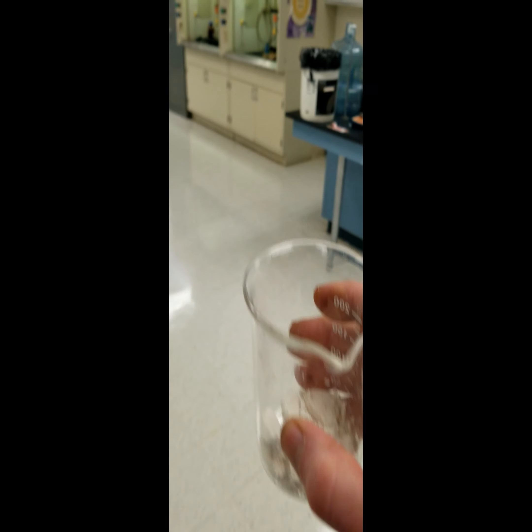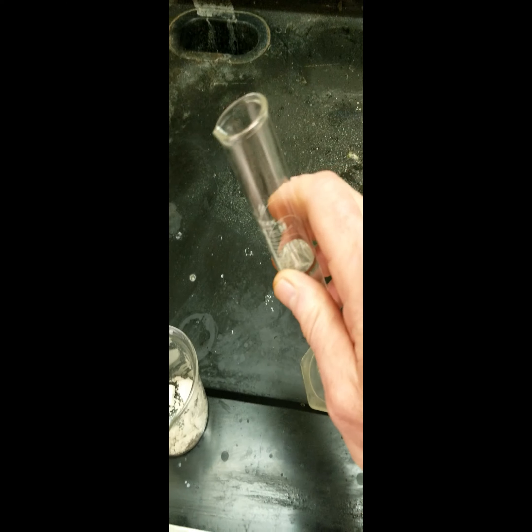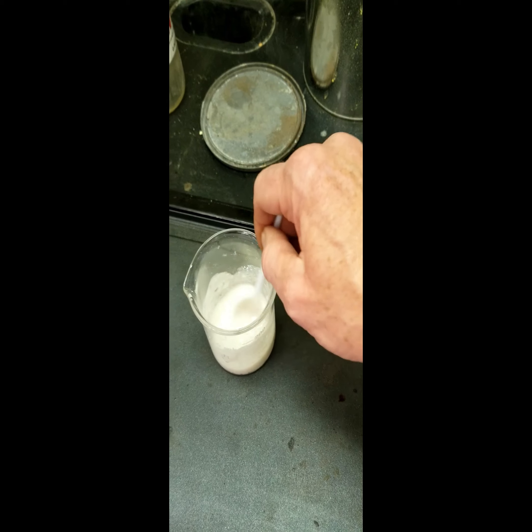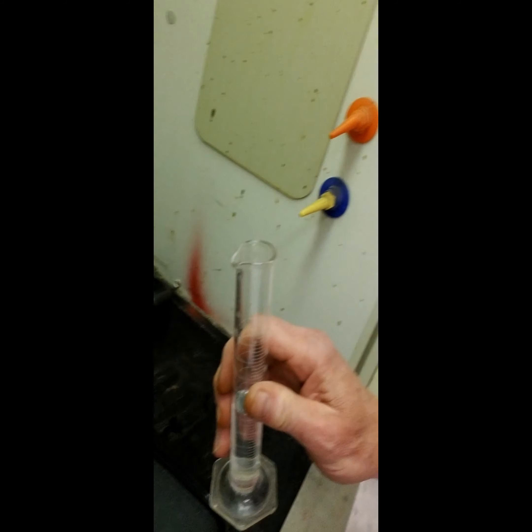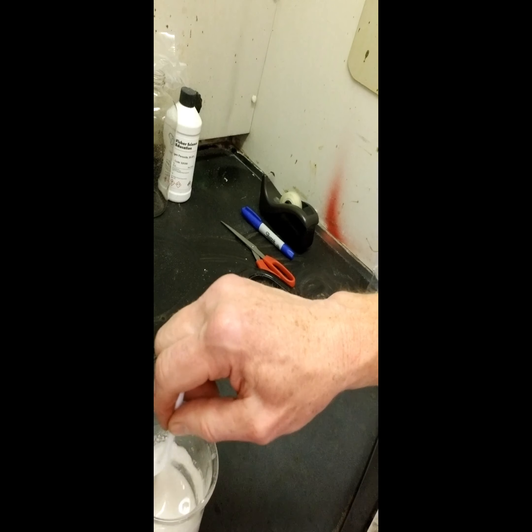Now, in the fume hood, we will add 40 milliliters of 15 molar ammonium hydroxide, or ammonia solution, to the reaction mixture. Heating will speed the nucleophilic substitution reaction. The nucleophilic substitution reaction should now be complete, so we will add some distilled water to our intermediate. Stir completely, then we need to filter again.